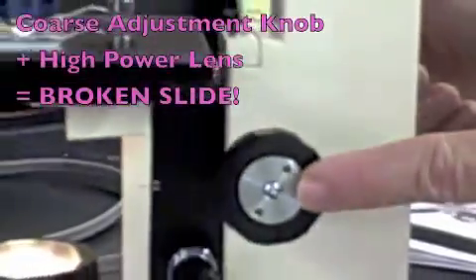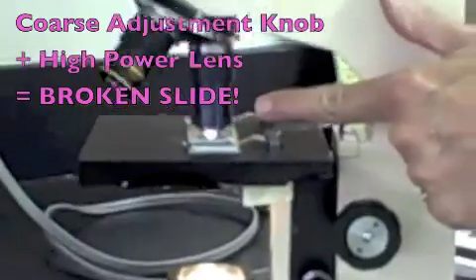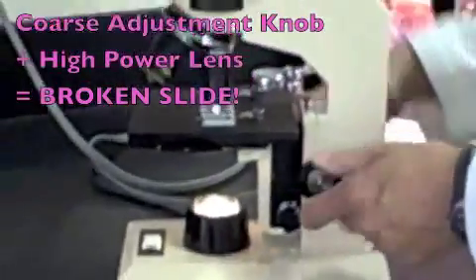If I were now to use the coarse adjustment knob on high power, like you were about to do, I would ram the slide right into the lens and probably crack both, the objective lens and the slide, and make a very terrible cracking sound. We don't want this to happen, because we don't want to break our lenses.